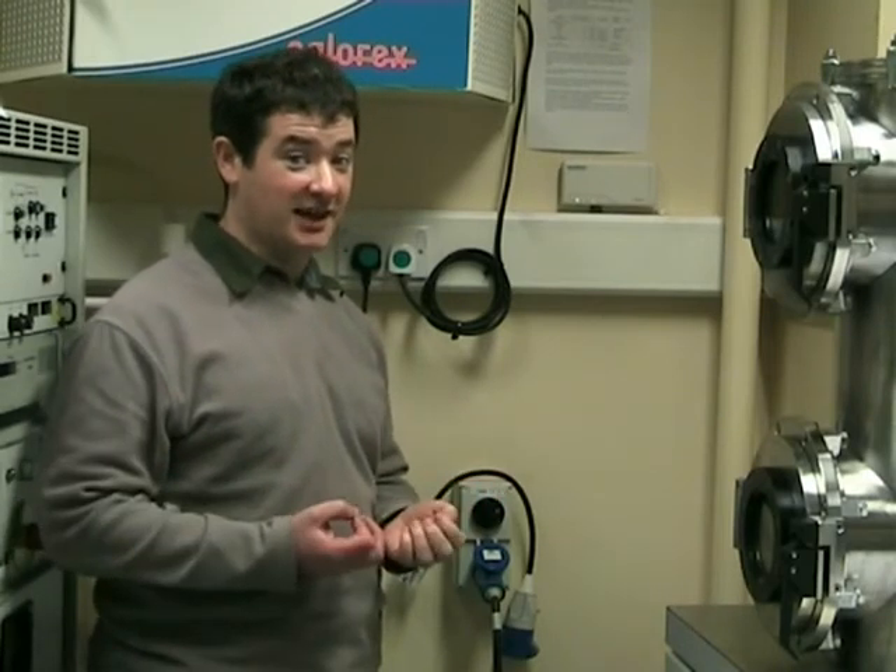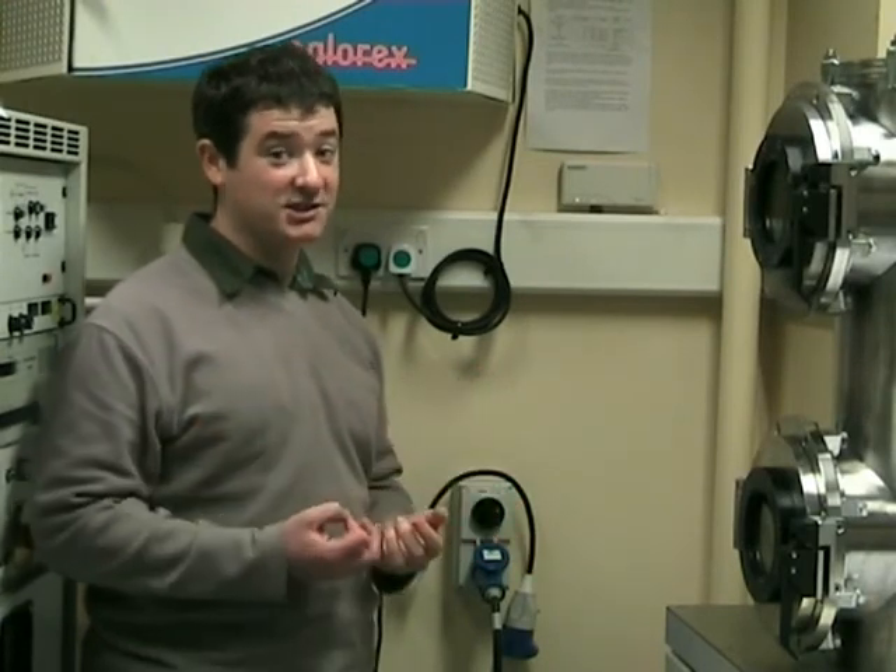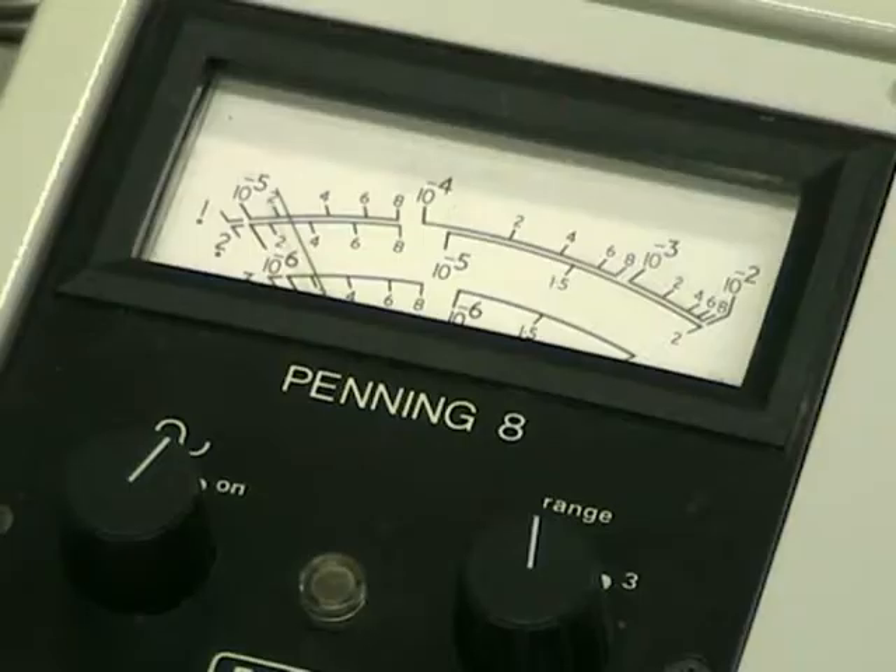As you can hear, when you do this, it creates a large sound. Therefore, tell people before you're about to turn it on to stop them getting scared. Next, turn off the pressure gauge as it can be damaged if operated at atmosphere.